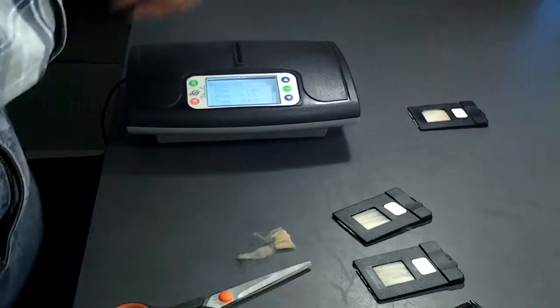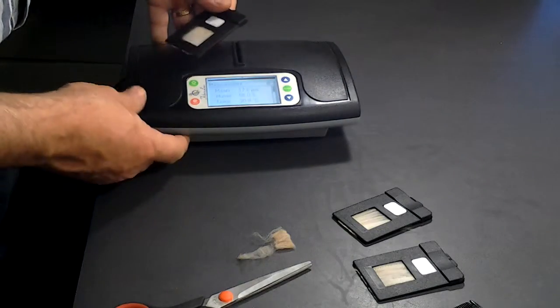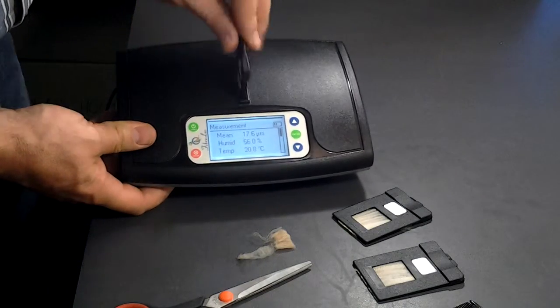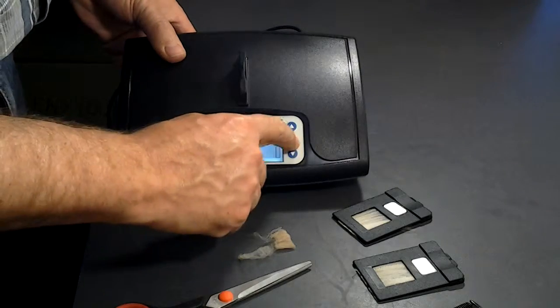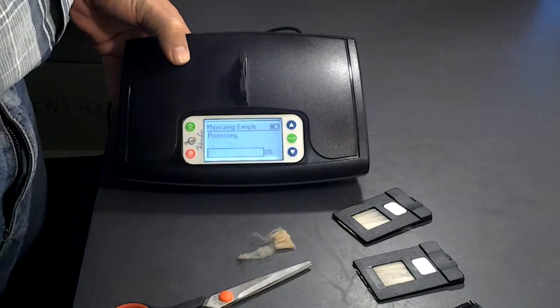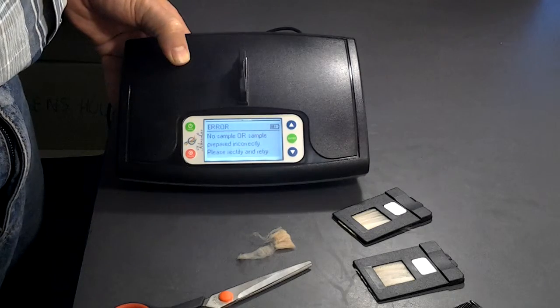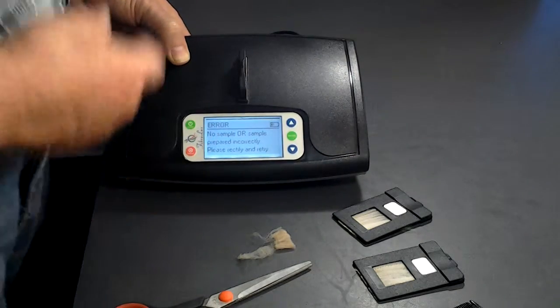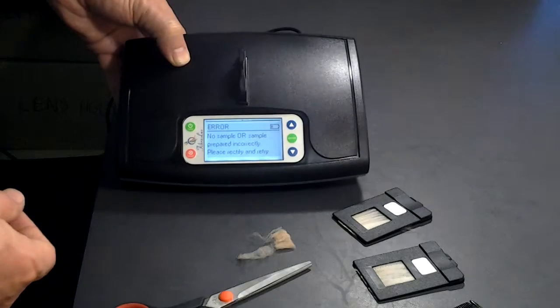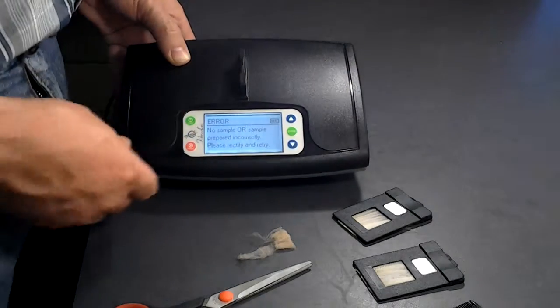Now, if you prepare the sample too dense, you would get an error message. Let me show you. There you go. Also when you do not have enough fibers, you will also get the same error.